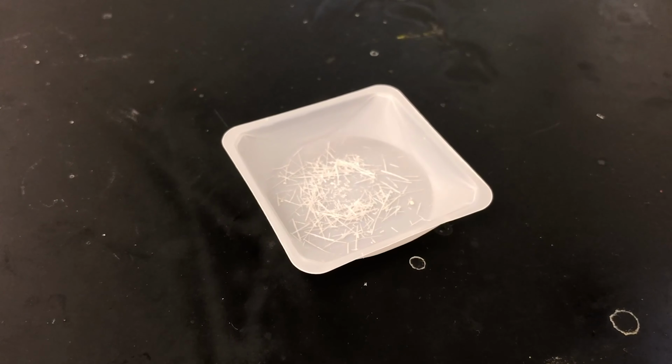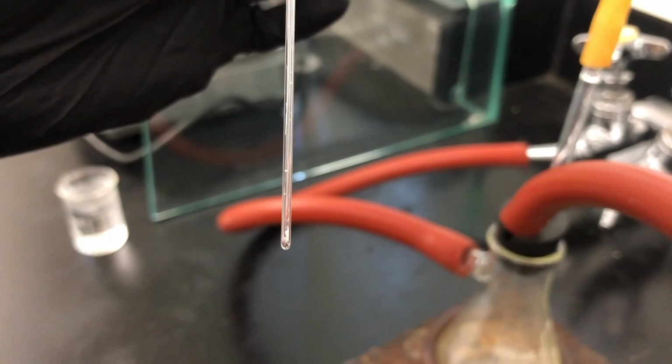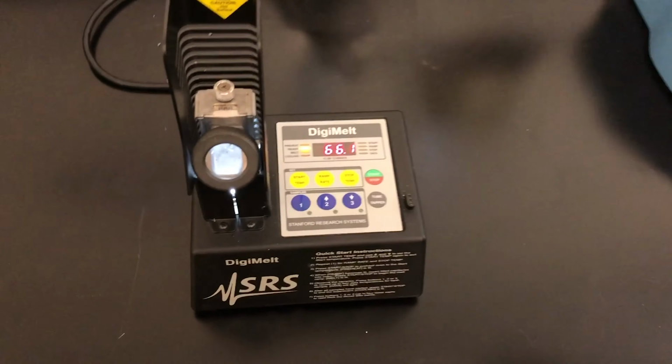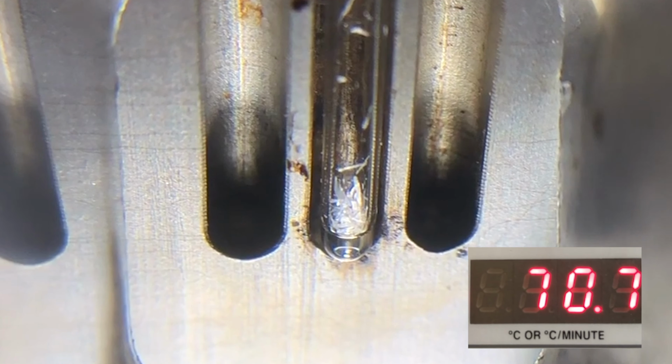At this point, we can begin characterizing our product by obtaining a melting point and a Nujol mull IR. The melting point can be obtained using an open-closed capillary tube and a small amount of product. Then agitate the product towards the closed end. The literature melting point of the alcohol is 72 degrees Celsius, so we'll start ramping up a little below that. Record the correct melting point range.